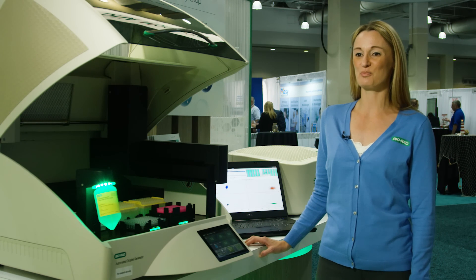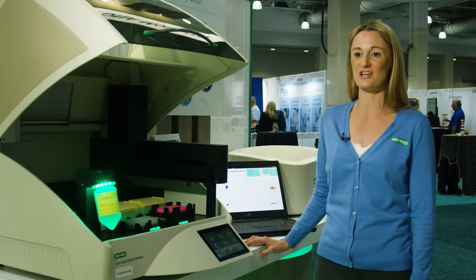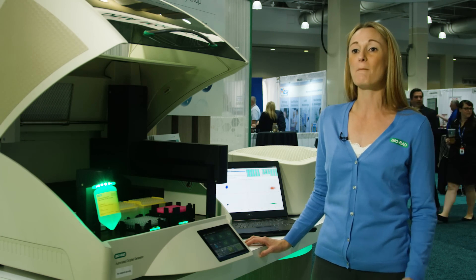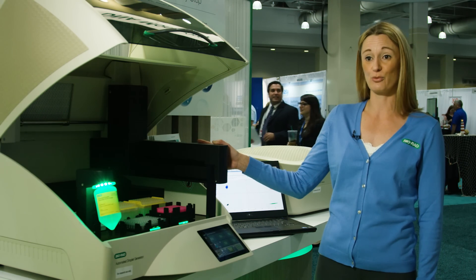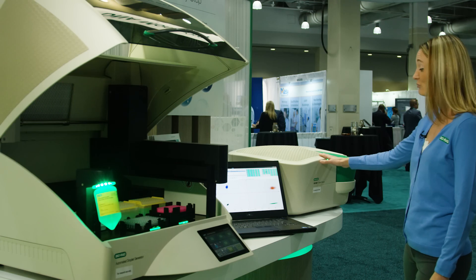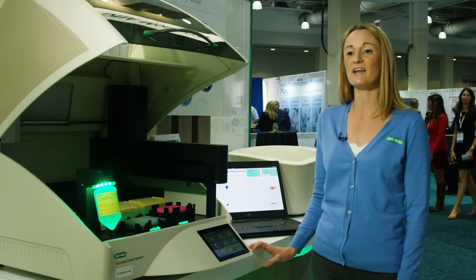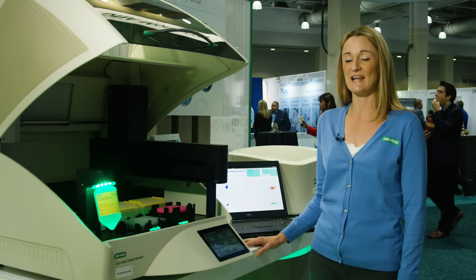As a market leader in digital PCR, Bio-Rad offers both instruments and reagents to support residual host cell DNA quantitation. For instruments, we have both a manual and automated droplet generator depending on your throughput needs. We have the QX200 droplet reader, and we also have Quantasoft software for data analysis. On the reagent side, we offer an E. coli and a CHO residual DNA kit.